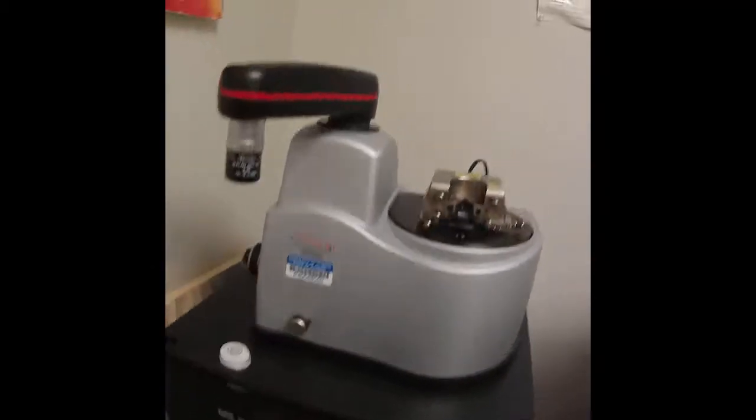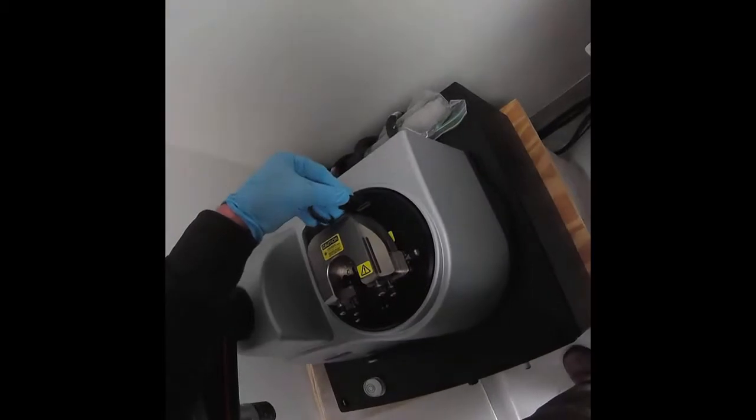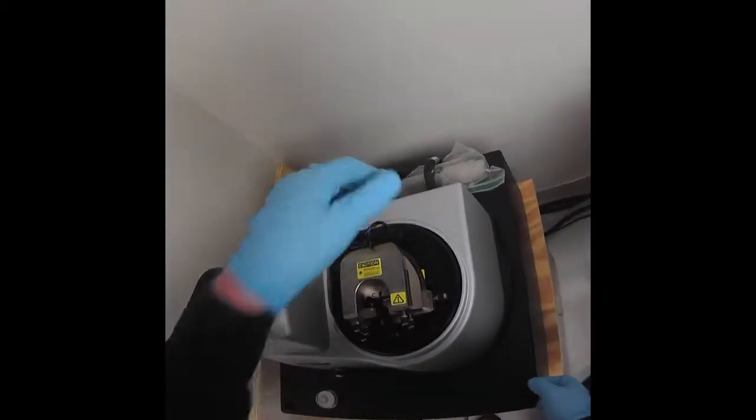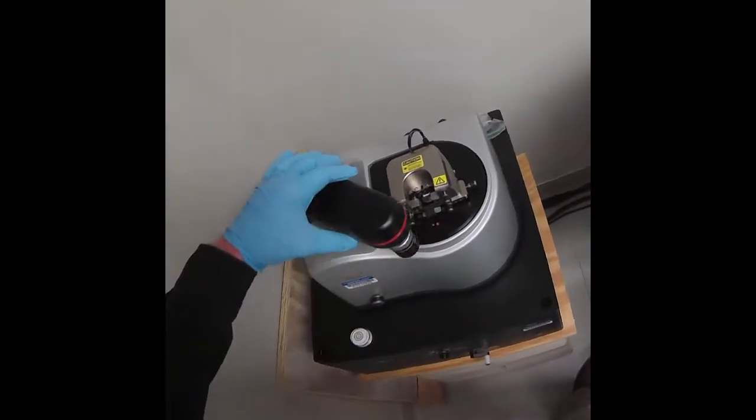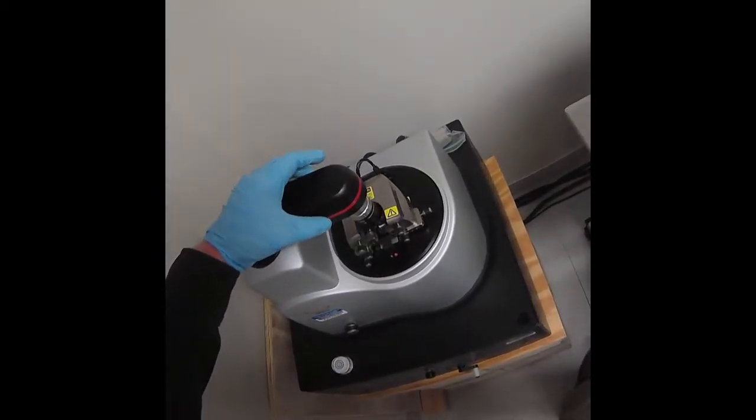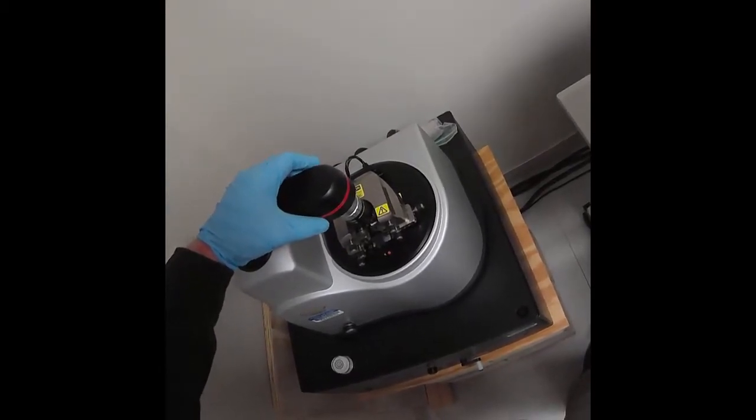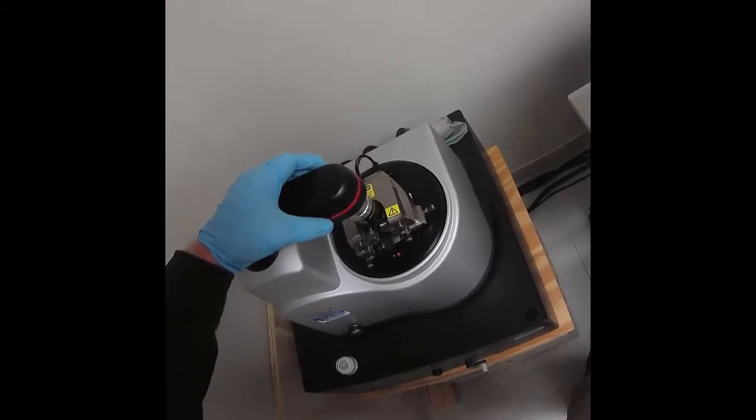Okay, that's a little closer than I really want it to be. Again, the only damage you can do—gently plug that in. You could break that if you force that. Same with this, gentle. When it's in place, there's a little indentation that it rests in, a little valley. So you gently move it until you feel that.